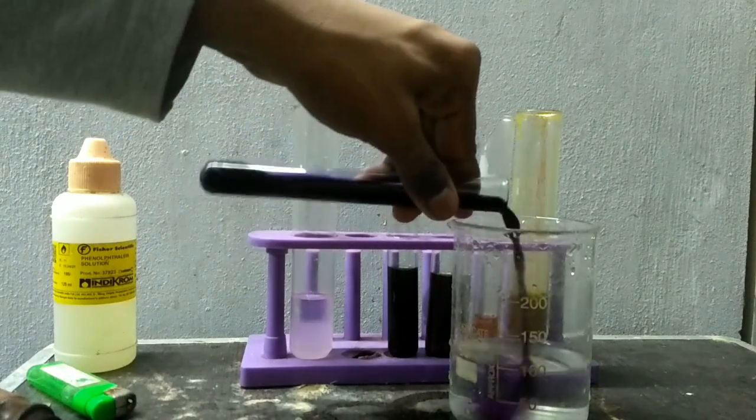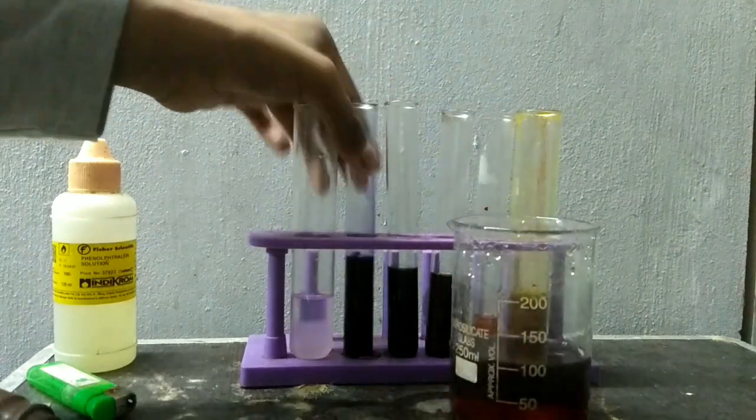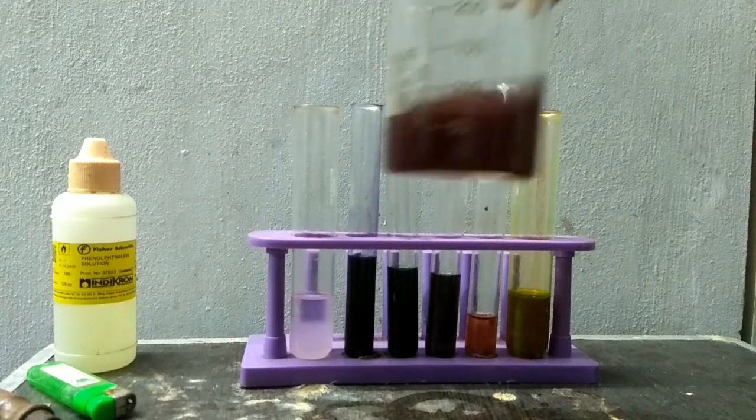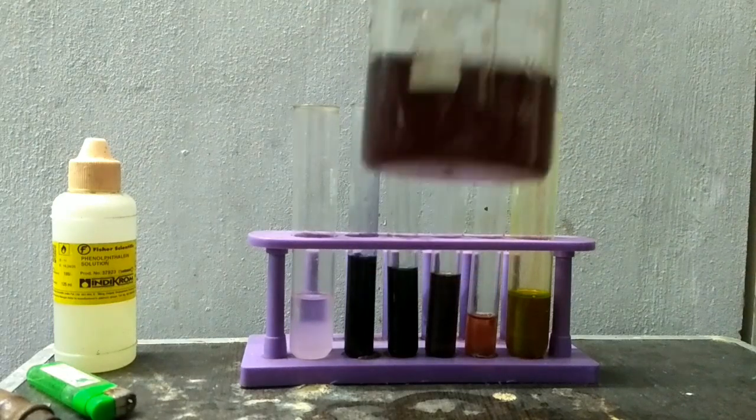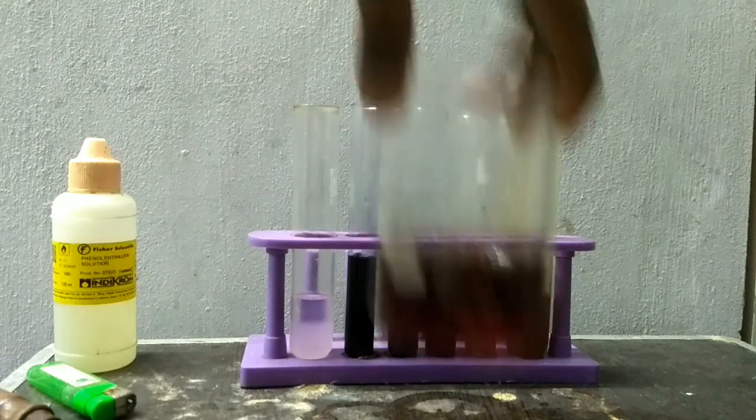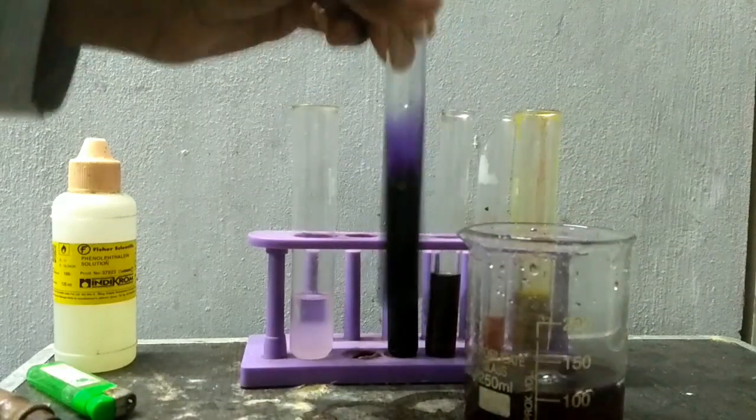This is hydroquinone one. On diluting, the color has turned pink but in the test tube it's violet.